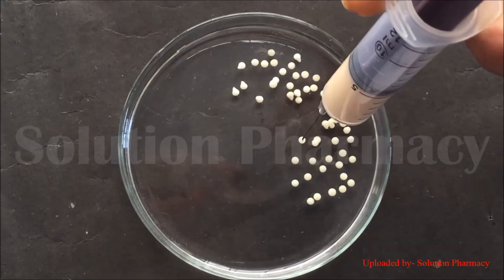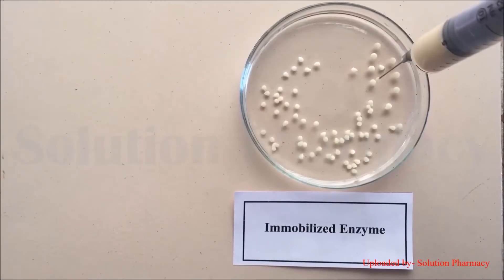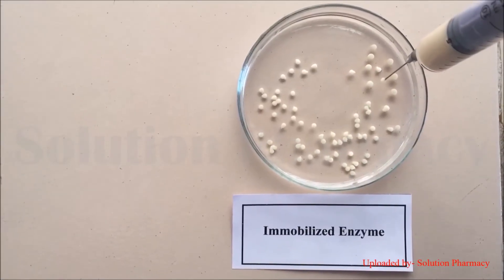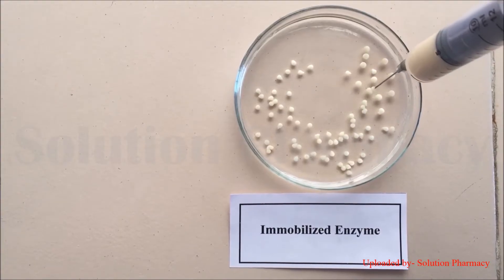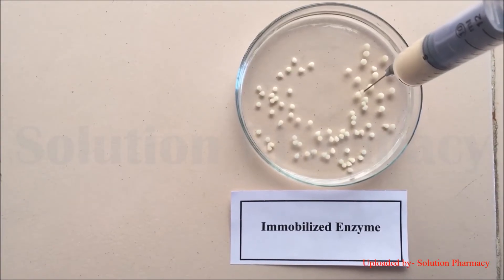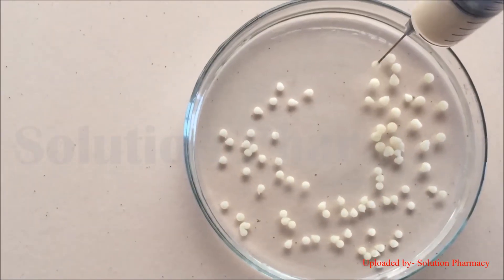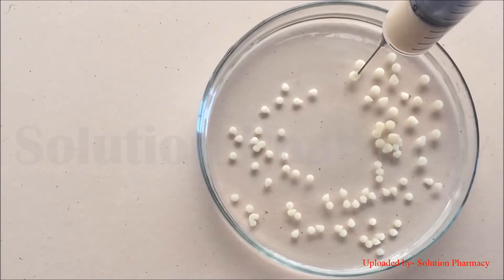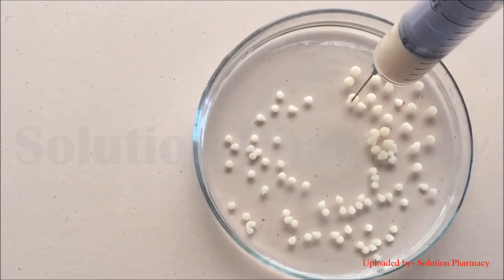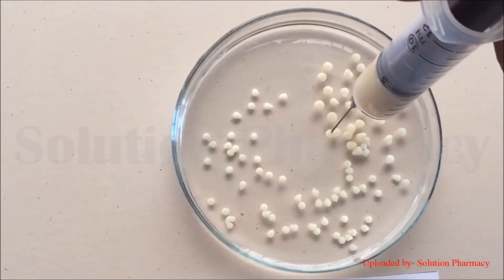As you can see, as each drop falls into the calcium chloride solution, beads of immobilized cells start to form. Here there is entrapment of yeast cells in calcium alginate beads — that is why this method is called the gel entrapment method.